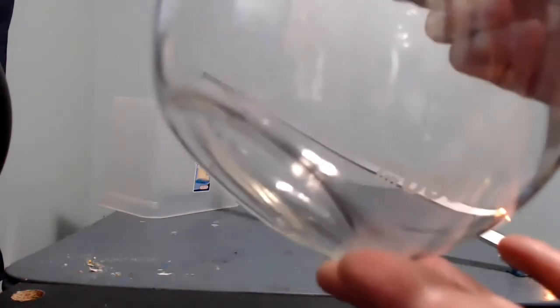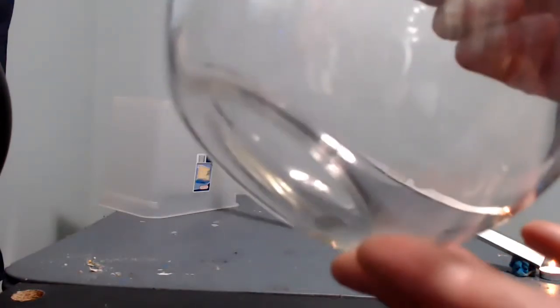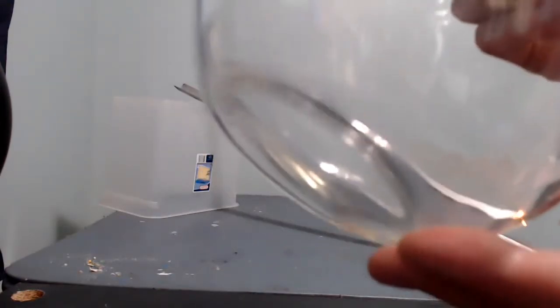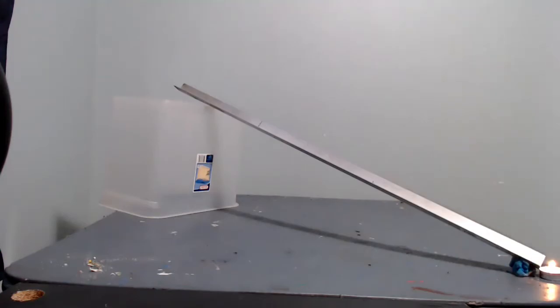So you're not going to be able to see when it's pouring down, you won't see anything at all because it's invisible. But we're going to make it visible because when it reaches the bottom here and reaches the candle, the flame here, it's going to ignite the gas.